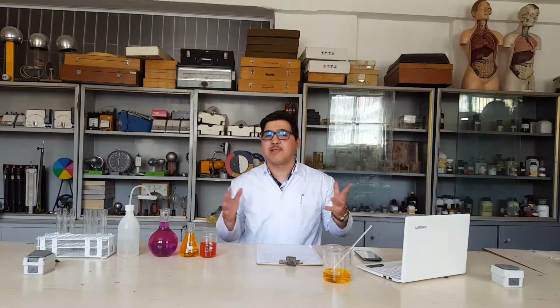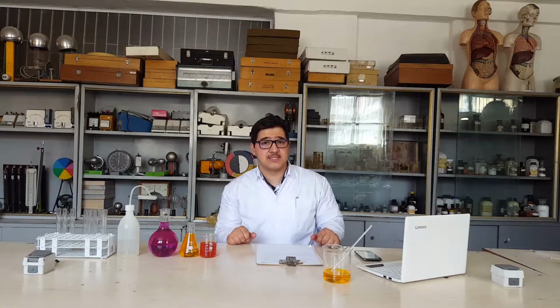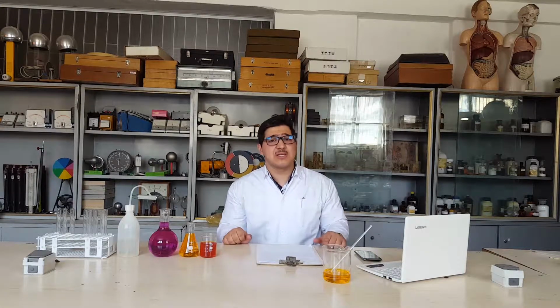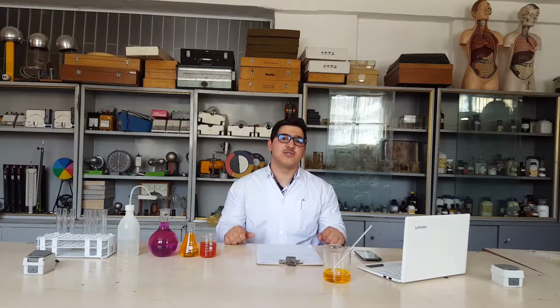Well, today we have plenty of things to demonstrate. Today we're going to talk about sodium and how it reacts with a bunch of acids. We're going to compare them and we're going to have some demonstration experiments on the camera. Because of that, I want to have a warm welcome to my professional assistant to show you and guide you to do this.